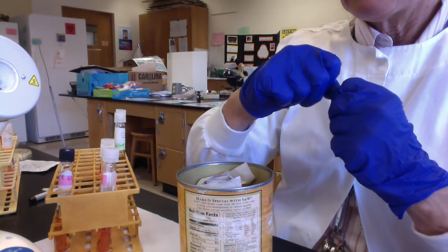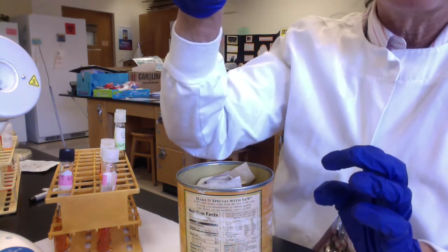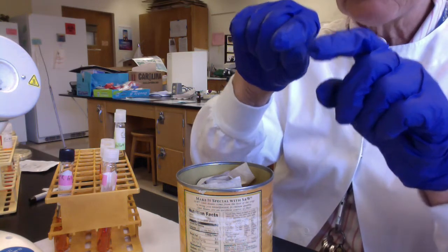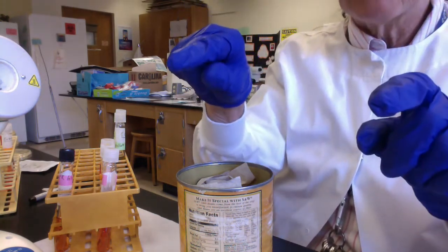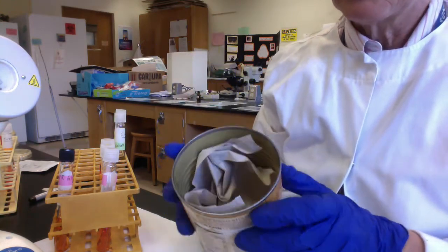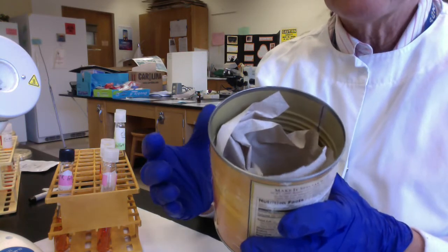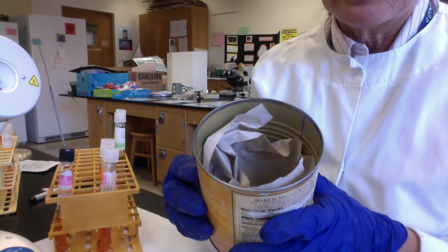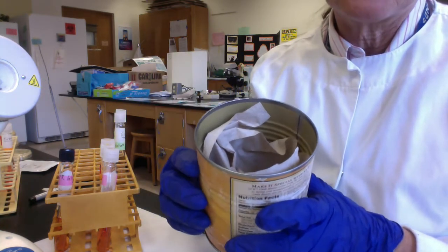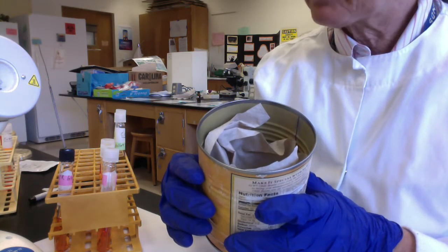the slant will explode, and part of the slant will get pushed up against the cap, and there's so much gas pressure that sometimes the agar and the microbes squeeze out under the cap and onto the sides of the tube. So we want to make sure that we have a disinfectant-soaked paper towel in here to help to inactivate any of the microbes that get pushed out. And also, before we handle the tubes, we're going to spray them with disinfectant again, because there might be microbial contamination on the outside of the tubes.